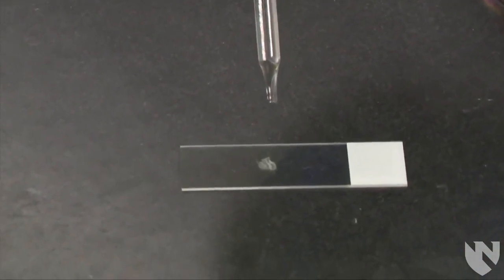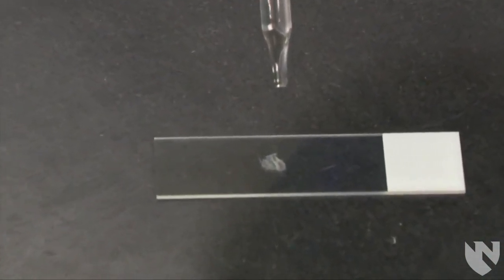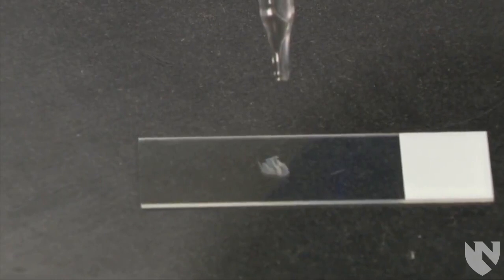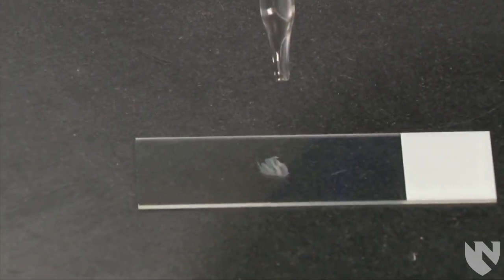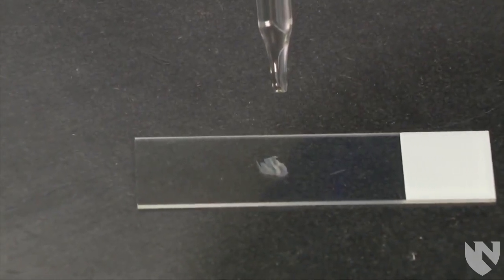Be careful not to touch the tip of the dropper to the slide or bacteria on the slide. You want to be about a half inch above where you place the bacteria when applying the drop.